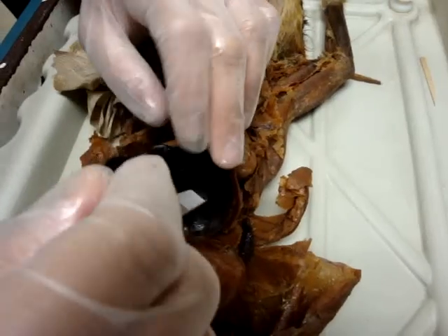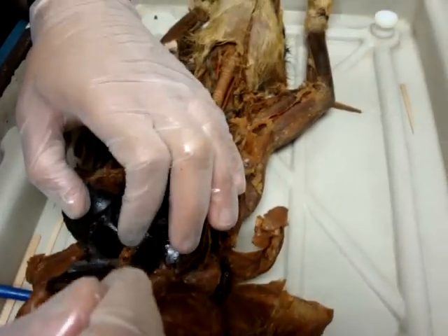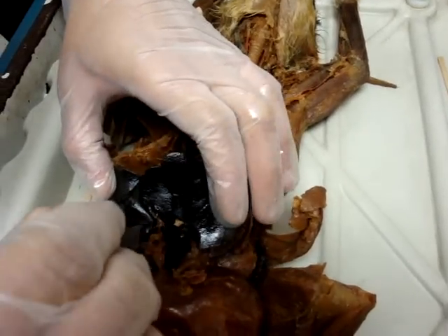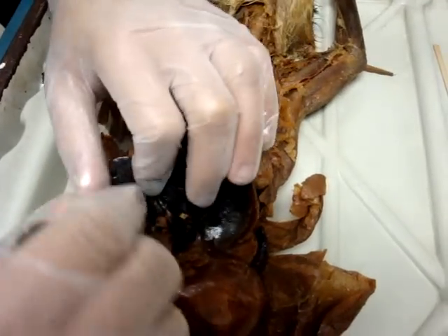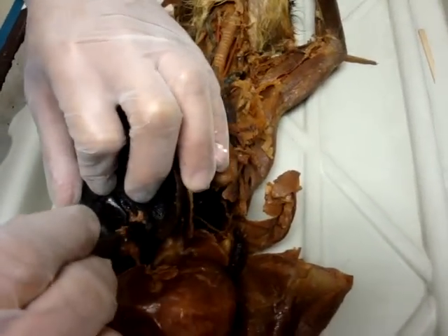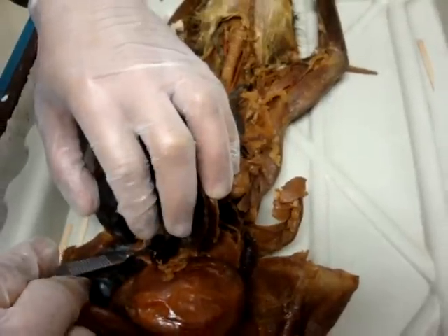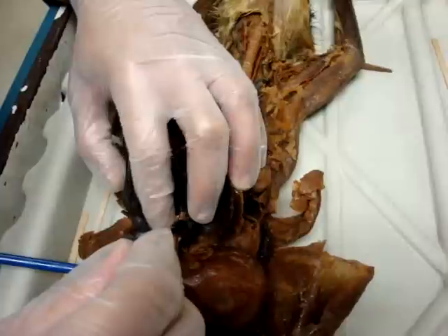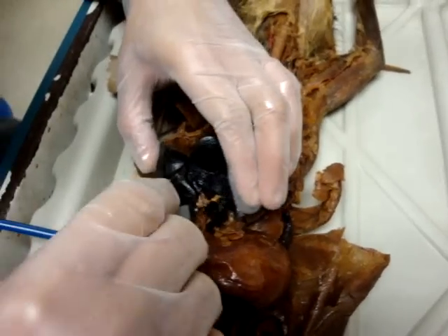But the liver — here's the liver. And the gallbladder. It's hard to see. Whatever she points to there, that's the gallbladder. In the book it's tiny. Anything green? It's green, so it might be under there. I don't think they cleaned it out — it might be crushed. But it's here somewhere, the gallbladder.